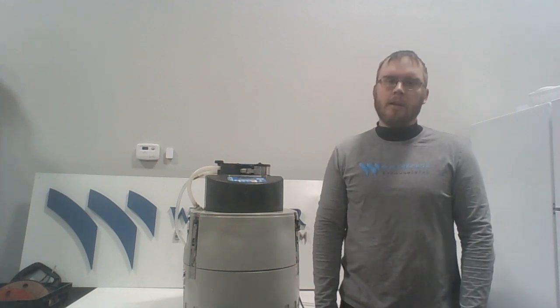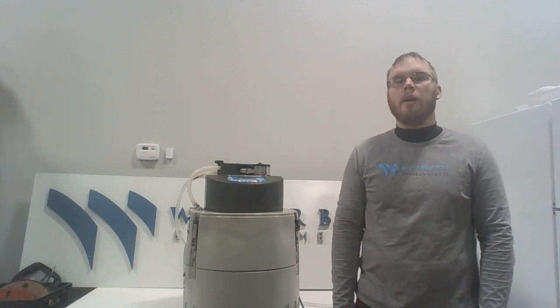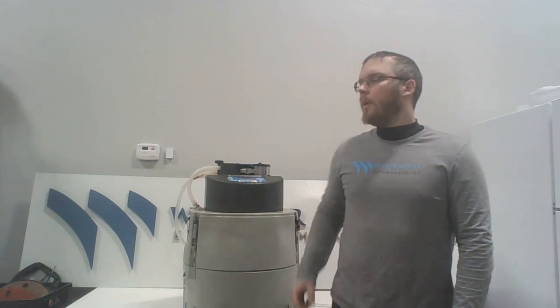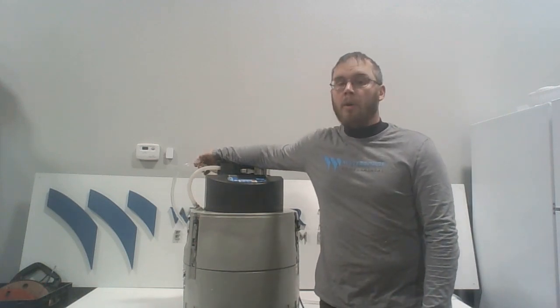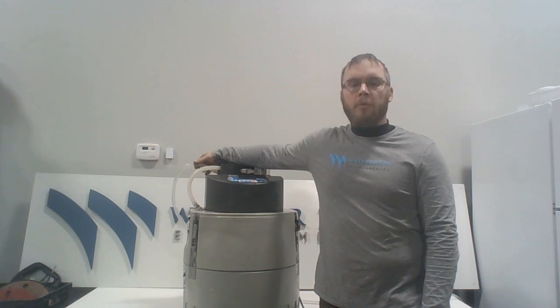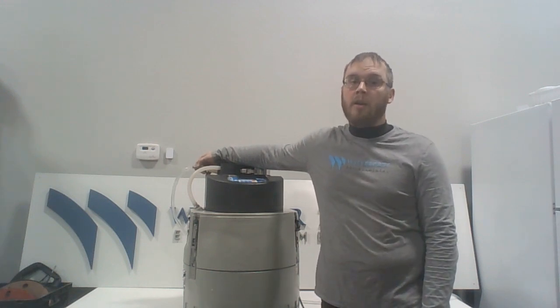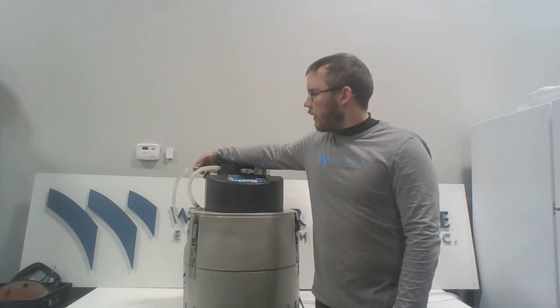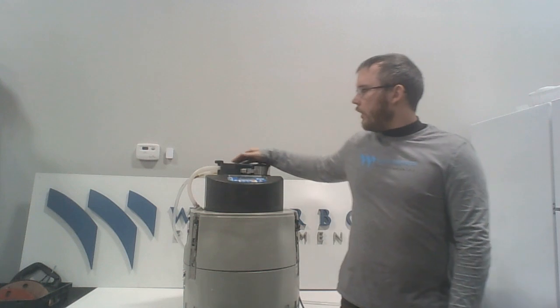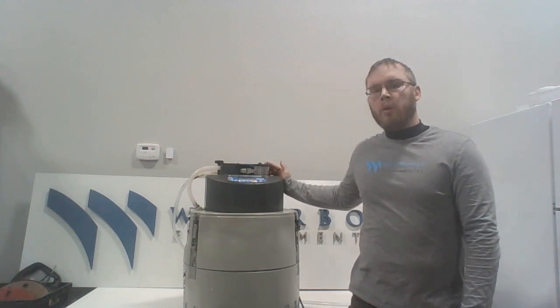At every site visit, we evaluate the condition of the intake line, starting at the collection point, and follow it up to where the intake line meets the autosampler housing. And what we're looking for are any obstructions, any kinks, any cracks, or anything that could introduce an error into our sample.